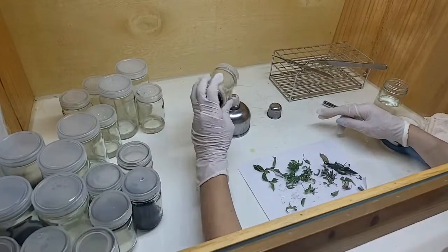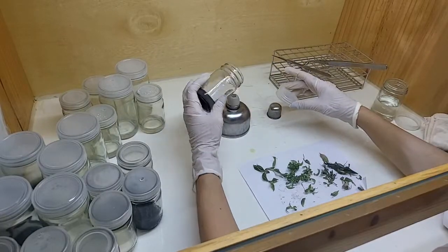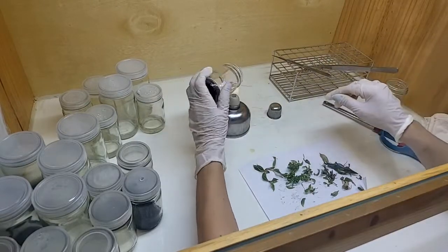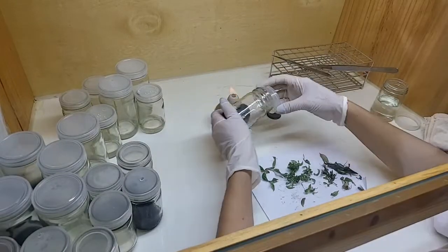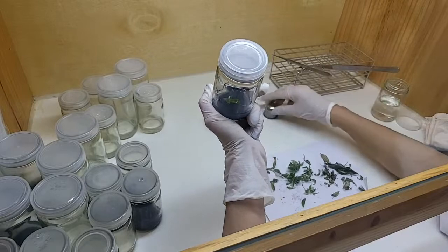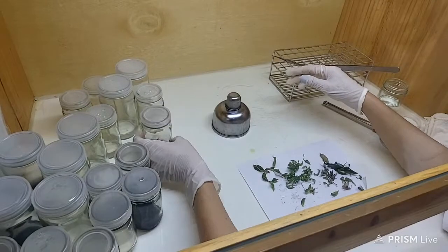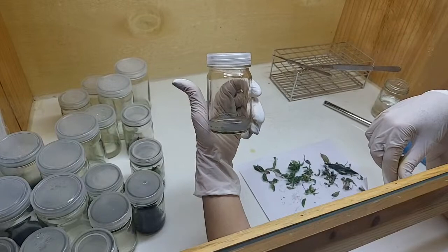That bottle — the black thing you're seeing there — that's actually carbon powder. We use this in our plant food at the stage of making the plant grow bigger. We separate the plants and let them grow; this will promote root growth and also the shoot. They will not multiply as much as with this other solution here.